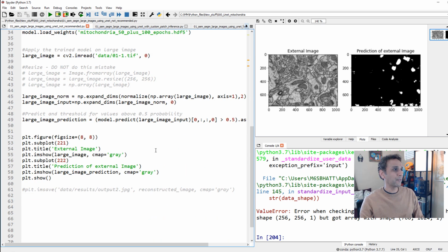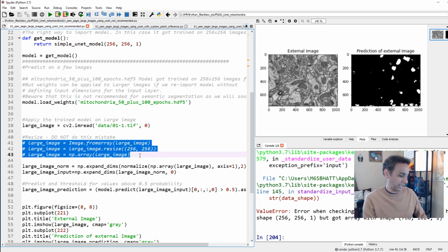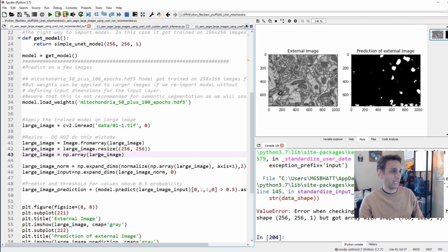I've seen people change this image size, resize it. So what if I resize this from 768 by 1024 to 256, right? So let's go ahead and do that. So that's what these lines actually do. I'm using the Pillow library because it makes it easy to resize. So there, now I'm reading the same image and I'm changing this to 256, and of course it should work.